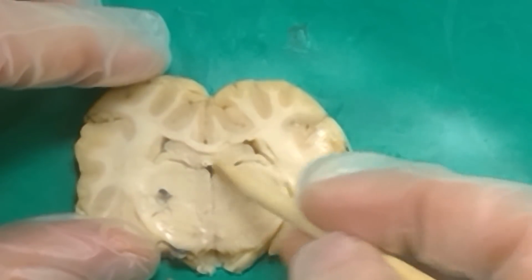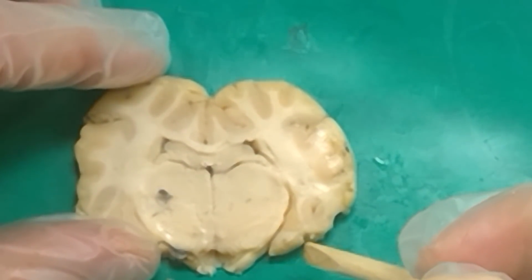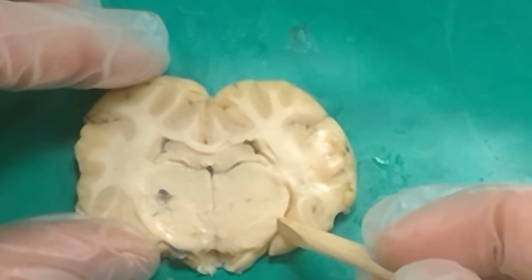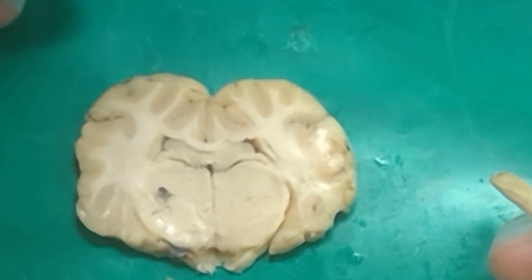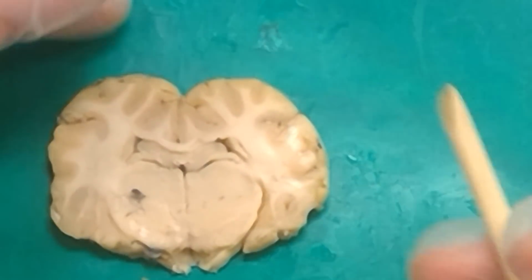So if you can see hippocampus here at the top, that means you've also got hippocampus at the bottom. You're no longer at the amygdala. So even if it seems like it's kind of a teardrop shape, there tends to be a curl swooping in at the bottom here. And that's how you know you're at the hippocampus, no longer at the amygdala. Because remember, you've got this C shape. Amygdala is right at the tip. And then you've got hippocampus here at the top, as well as at the bottom.